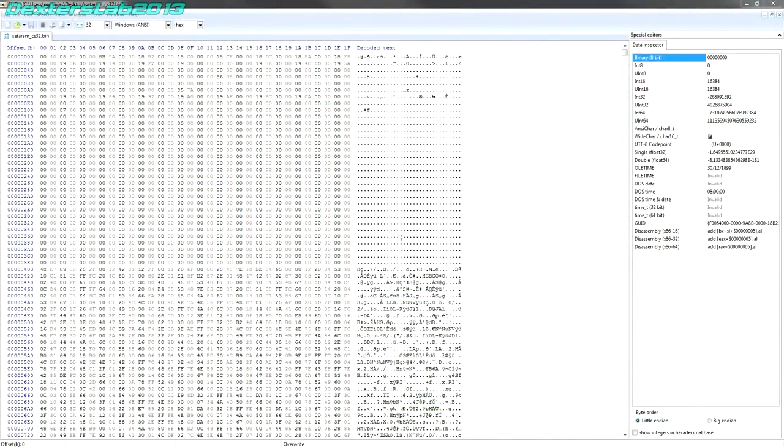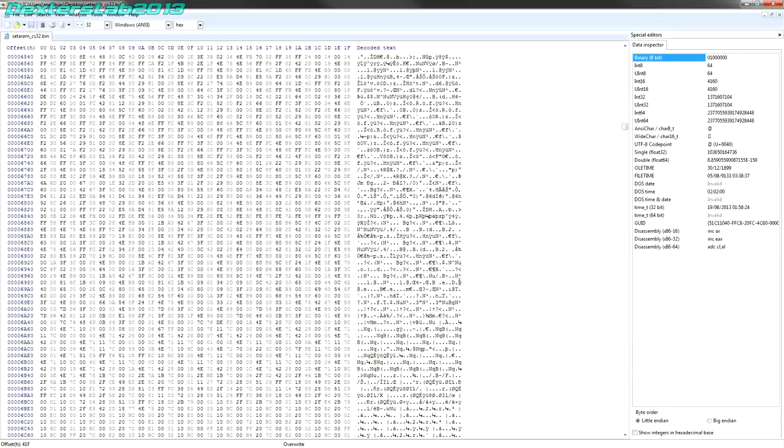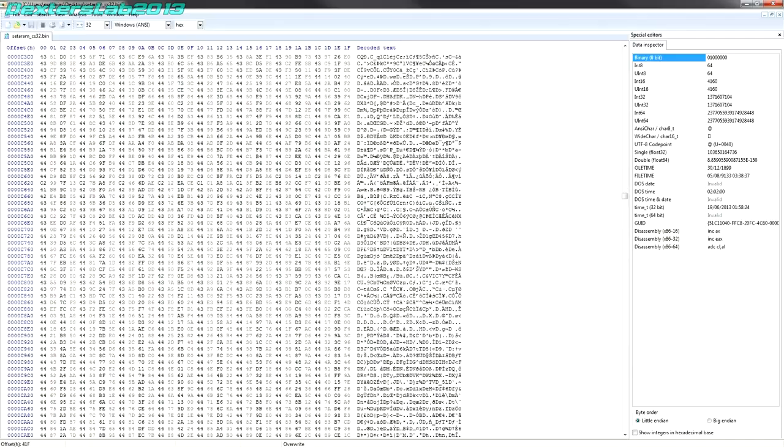Right, I've just got this loaded into a hex editor. So this is right at the beginning of the EEPROM. So right at the beginning here, we are going to have the reset vectors for the CPU. I'm going to imagine this is just mapped in straight, starting at zero in the memory space. So these are going to define the initial vectors, and I'm trying to remember which one is which, but it looks like the code starts at 400 here. So this is all going to be 68K machine code. So not really anything to see in there without running it through a disassembler.